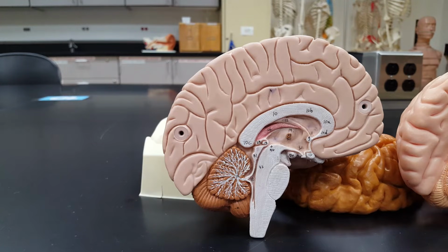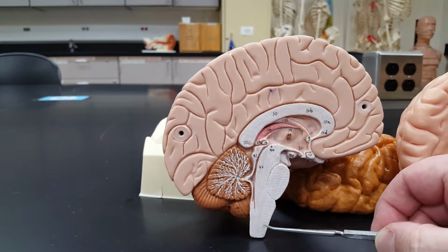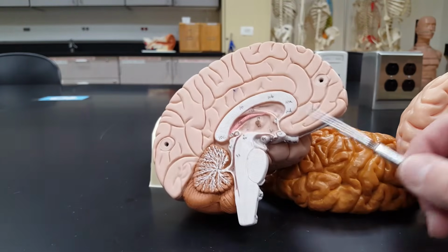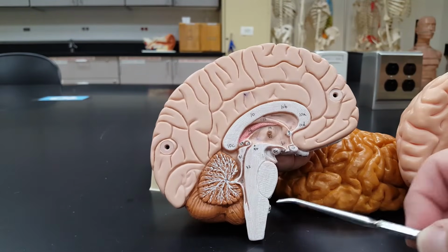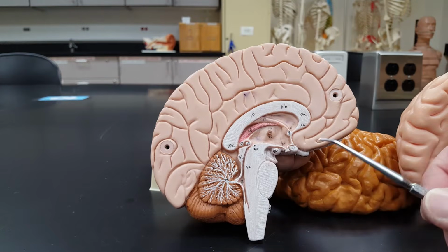Now, I'm not going through functions here. You'll be doing that in your lecture, and I do not want to steal the fun of your online lecture. And brains are fun. It's fun to talk about brains. But the brain stem from here, see where it starts to widen, right up to here where it changes color, that's the brain stem. Medulla, pons, midbrain.